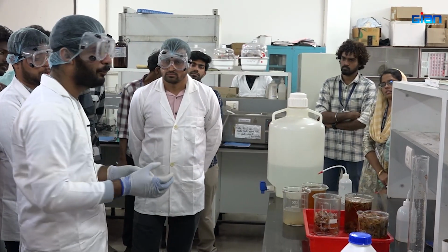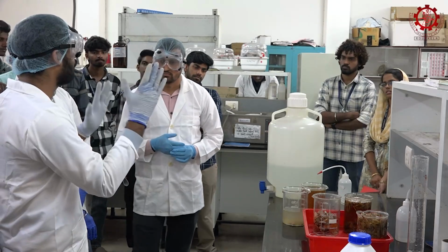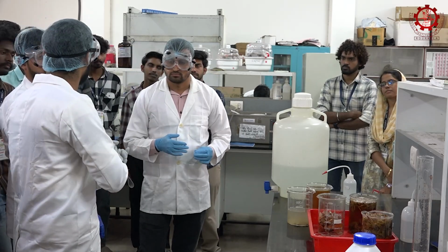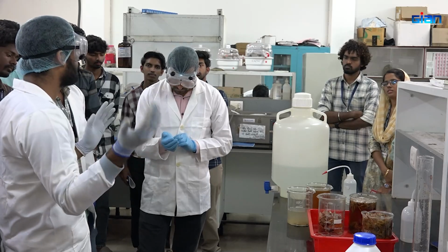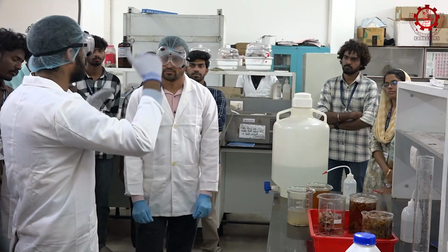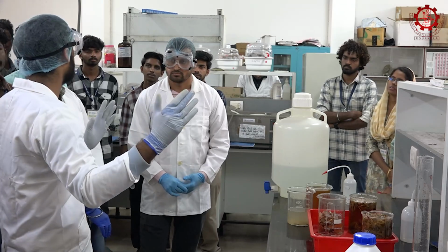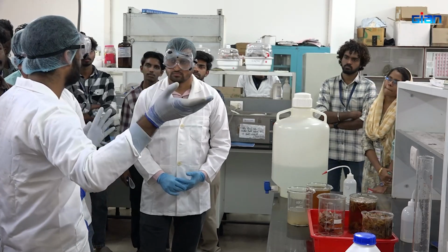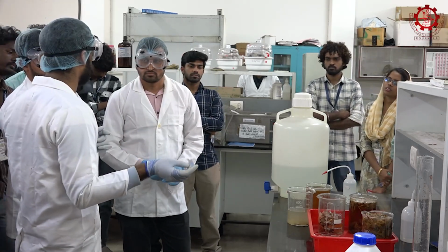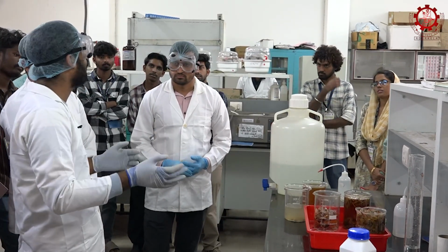Any other fraction, if it is present in this chitosan? It's not 100% pure. If some impurities are there, then how can we identify them? There should be some other functional group, apart from the particular functional groups which belong to chitosan. So we can easily differentiate that there are some other functional groups there, and that's why the graph will be varying. If we are correcting the peak, there should be some other group there. If any group which belongs to calcium hydroxide or some other fraction is there, then we can say it is not pure chitosan.